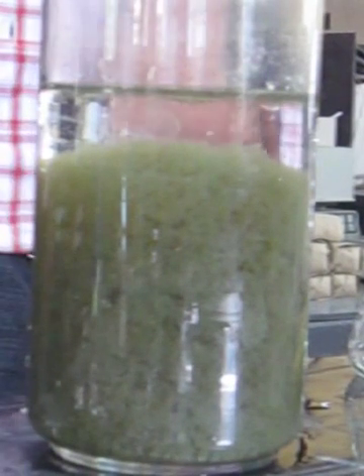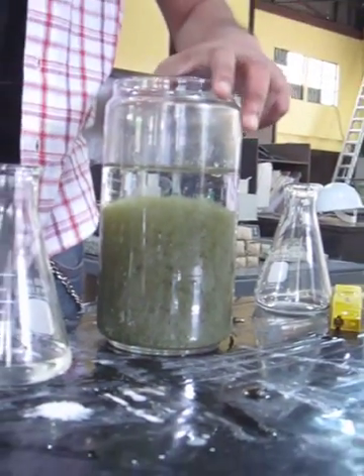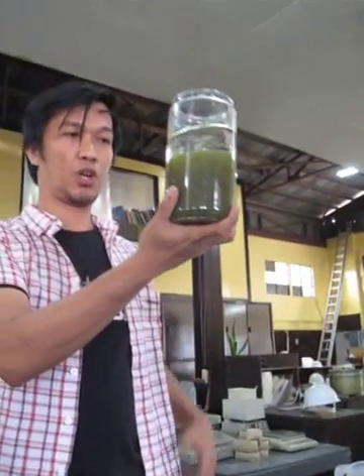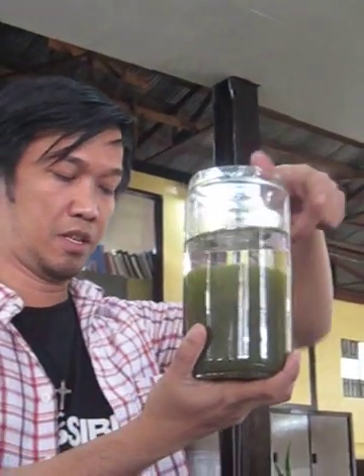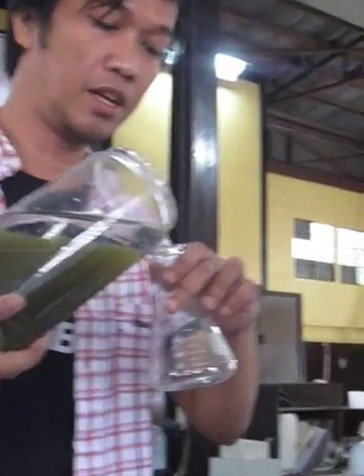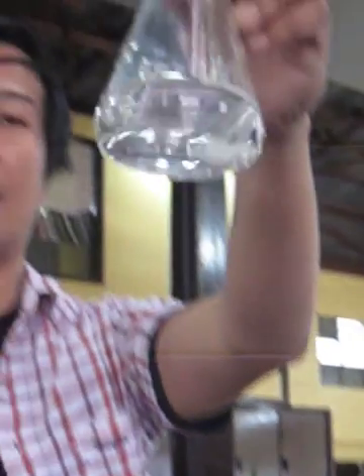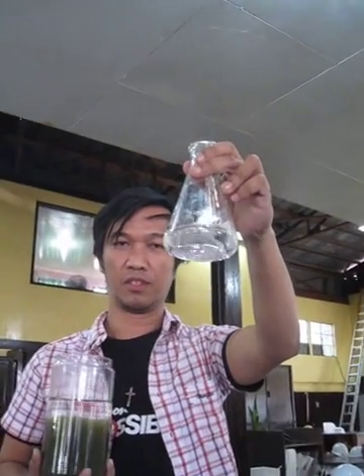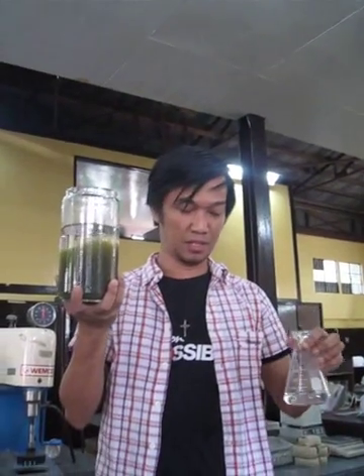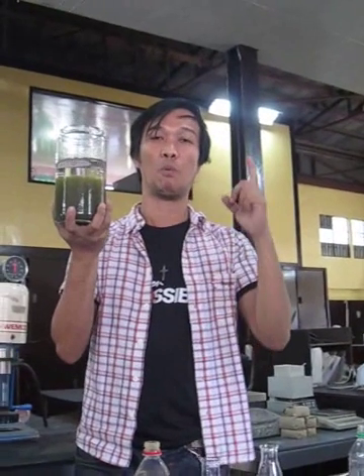So there you go — copper is recovered 100%. As you can see, there's a significant separation of copper and treated water. We're going to decant this to let you really see that it's really clear. So there you go — with just one drop of our product, copper can be precipitated 100%.